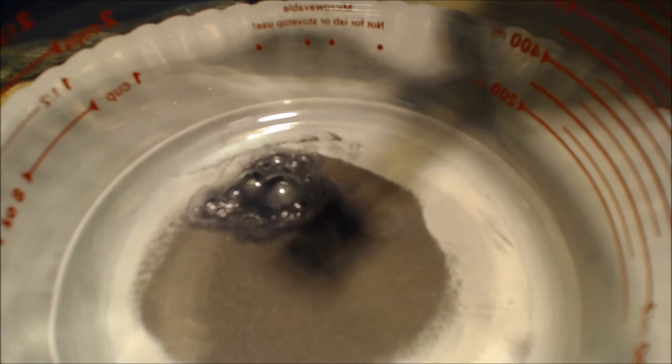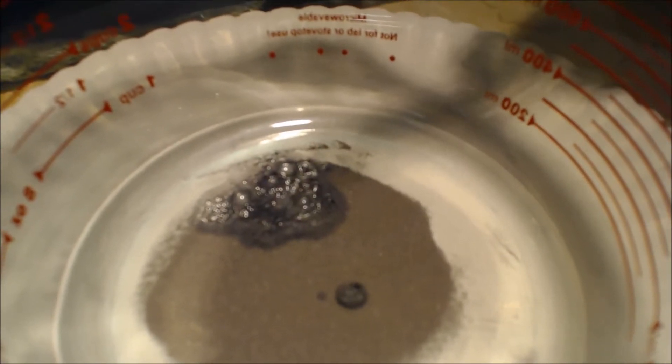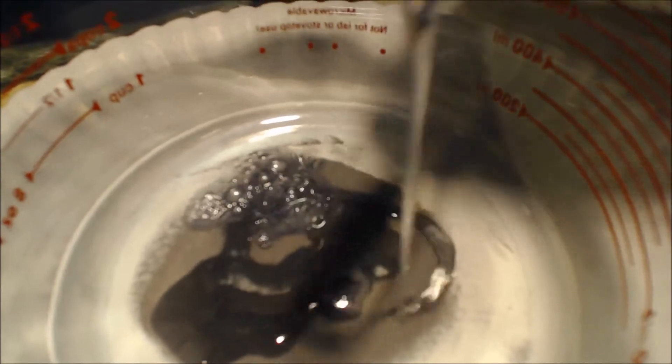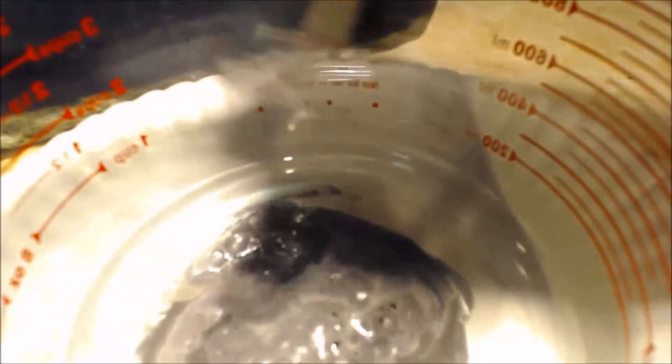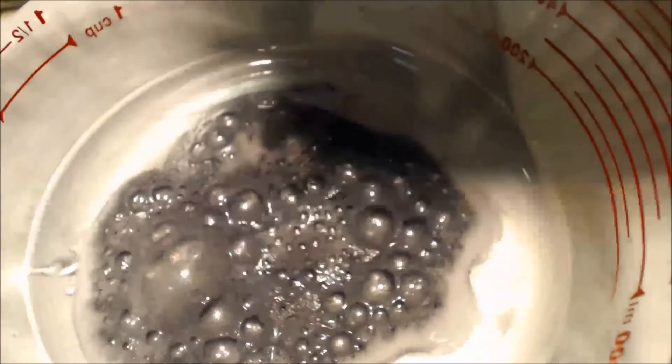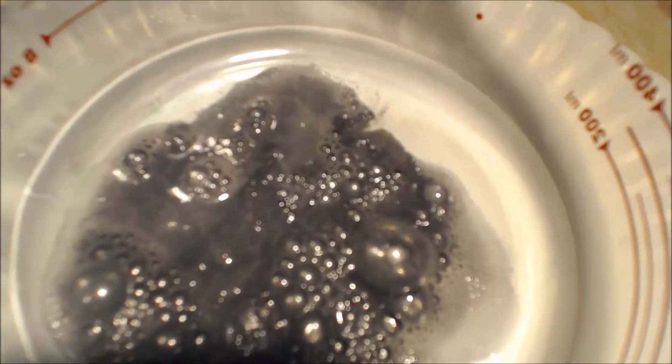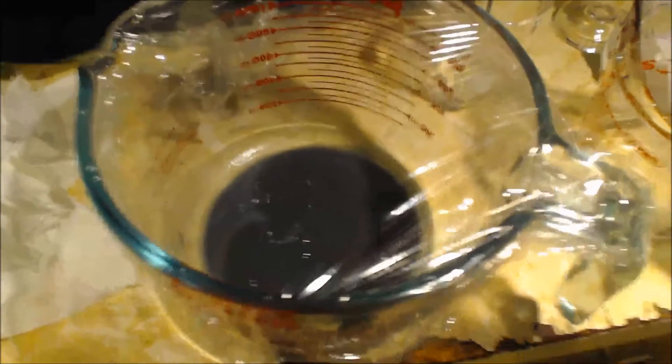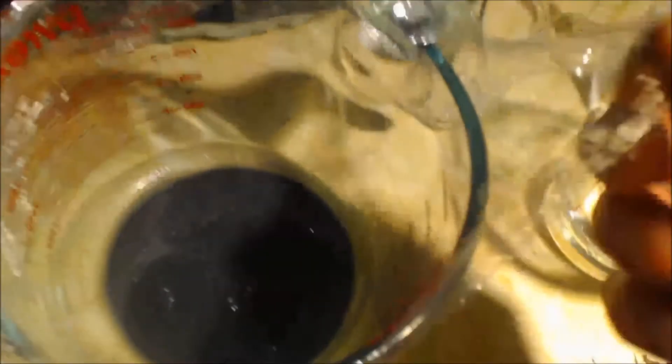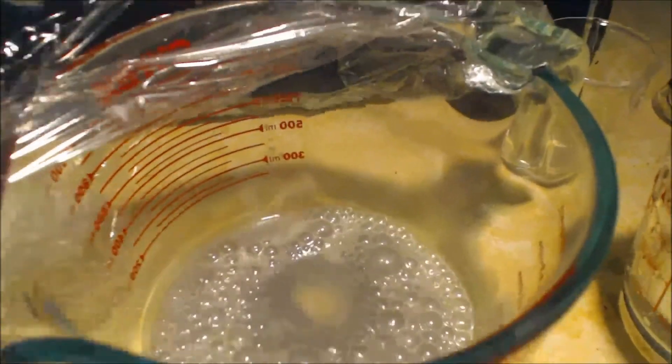That stinks. It kind of smells like sulfur. I thought it turned green. It still looks gray. I don't know why this didn't turn green. Let's add some water. Then I'll add another five milliliters. Maybe because it's just sulfate in there and you need to speed it up or something. It's gray. Oh crap. Oh Jesus.